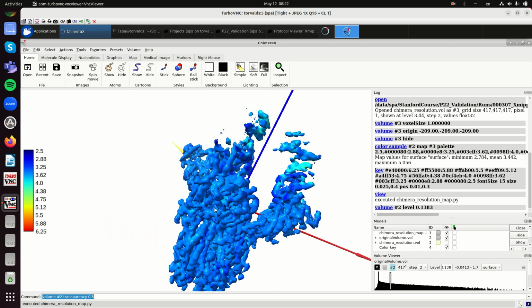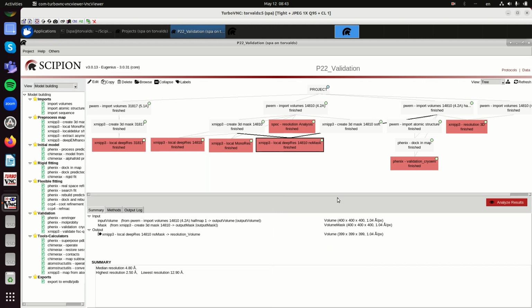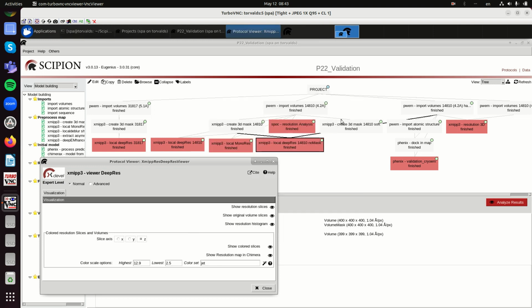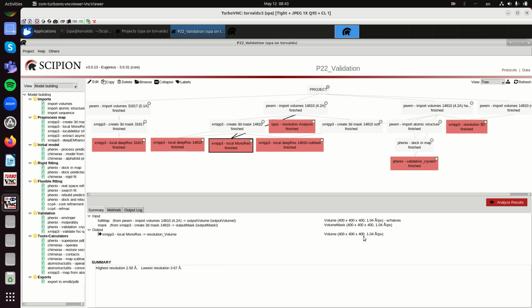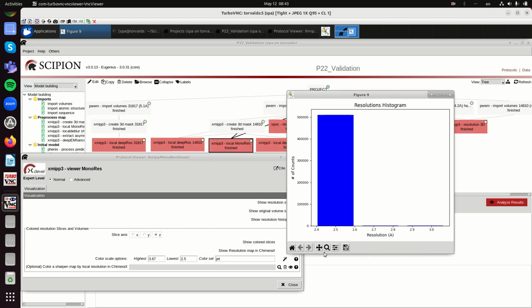So if we apply DeepRes to the half map, now the resolution drops from 3 to 5. So now it looks more like a 5 point something reconstruction. So the mask really influences a lot all your measurements of resolution. Also MonoRes, for instance, that is another local resolution analyzer, is also fooled by the masking. MonoRes looks at the signal compared to the noise, and the noise is defined as the background. So if there is no noise in the background, your signal appears to have extremely high resolution.